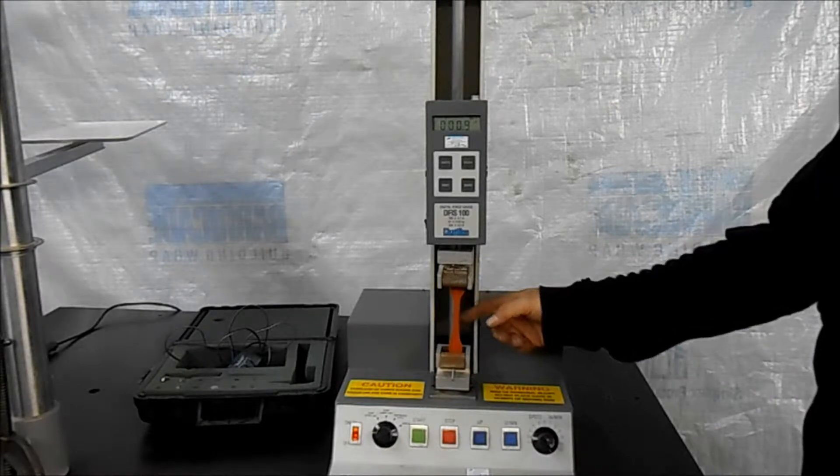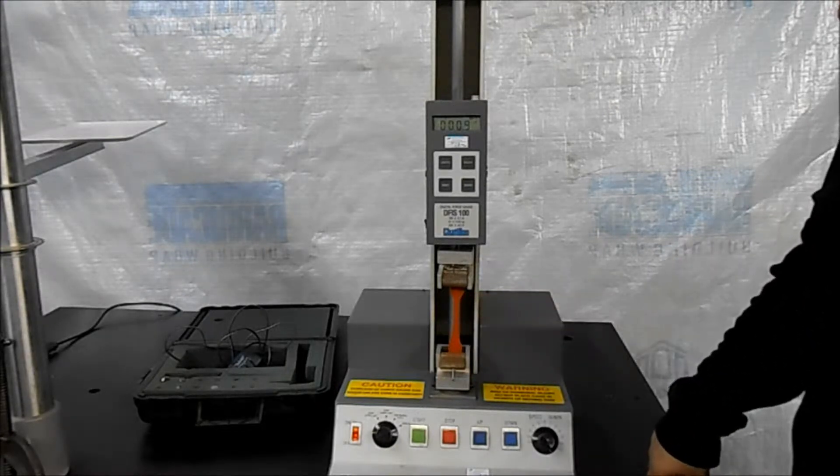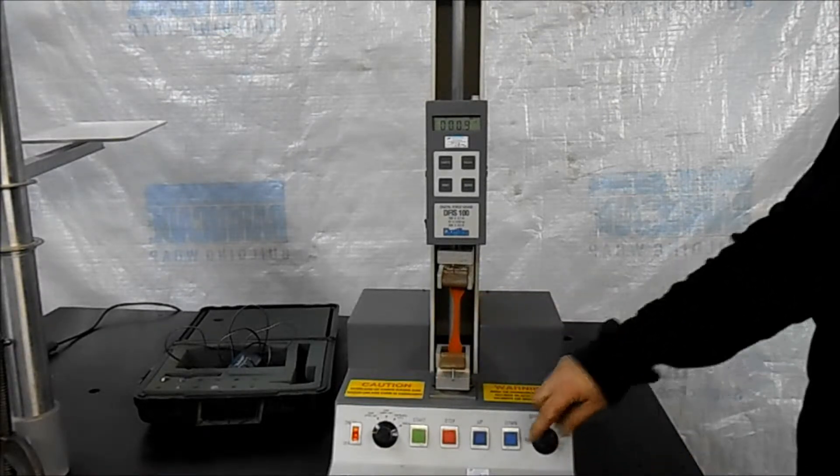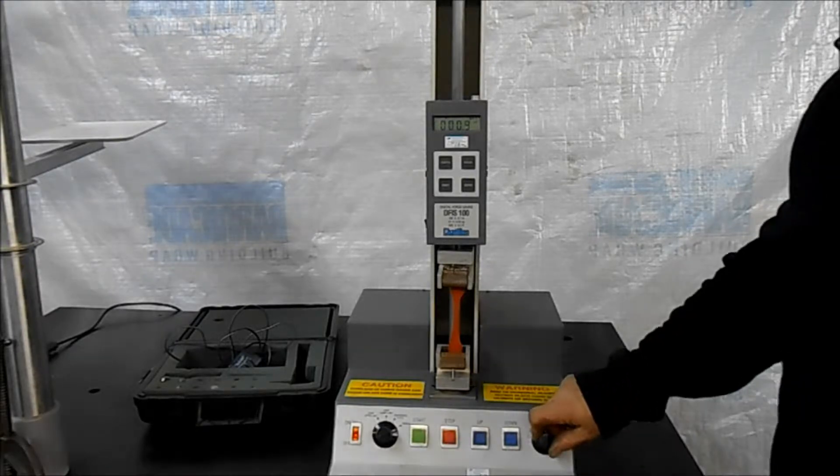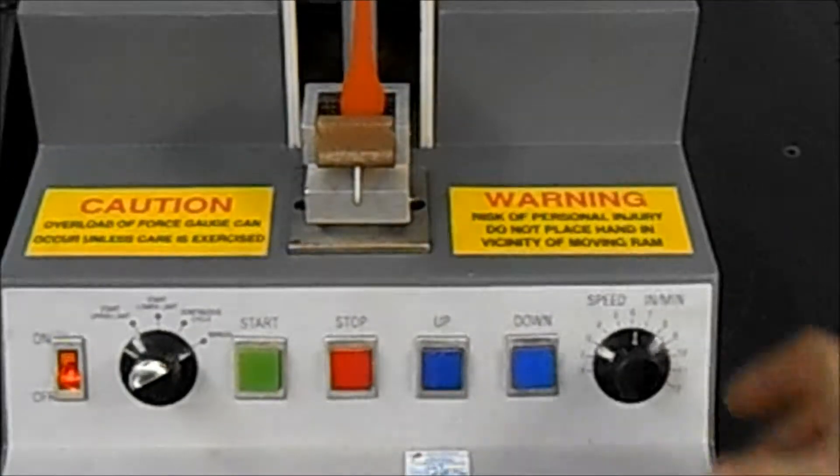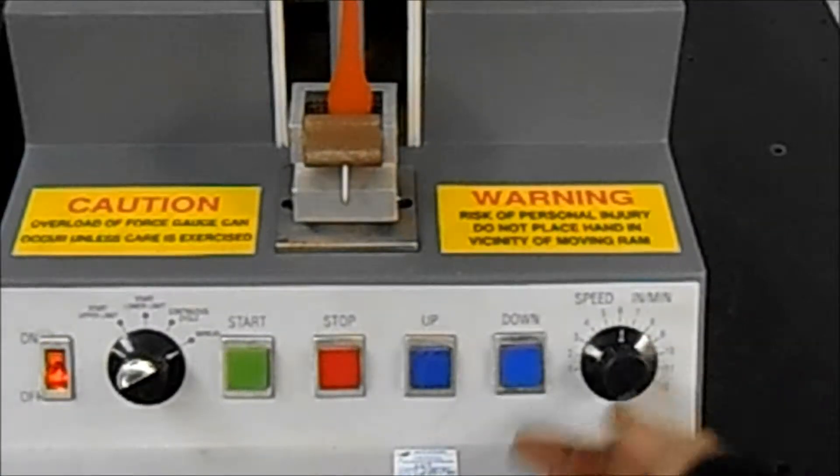So this is under a little bit of tension right now just to keep these closed, but we'll fire it up here. It's got a speed control that can be used to change the speed at which the testing takes place and that goes down to one inch a minute and up to 12.